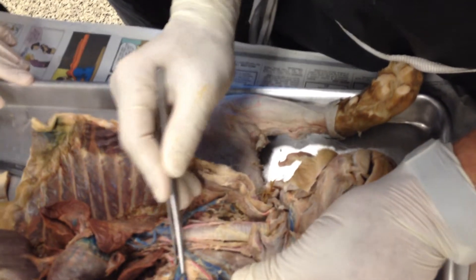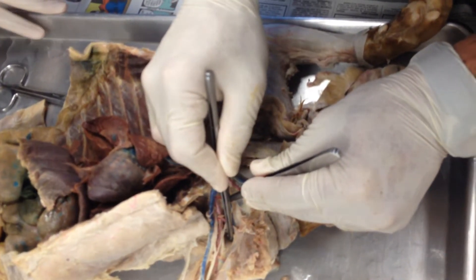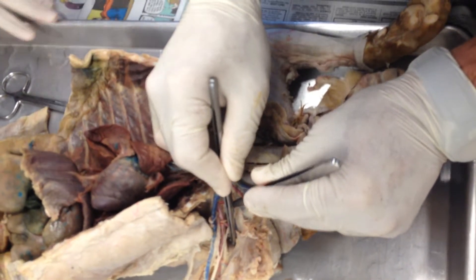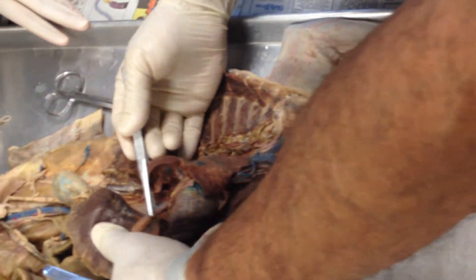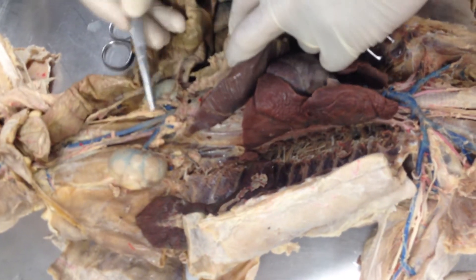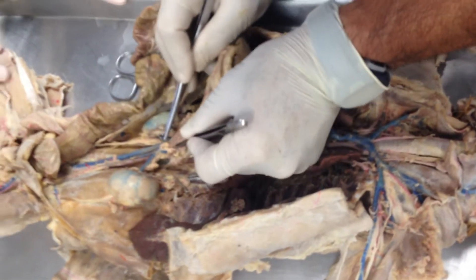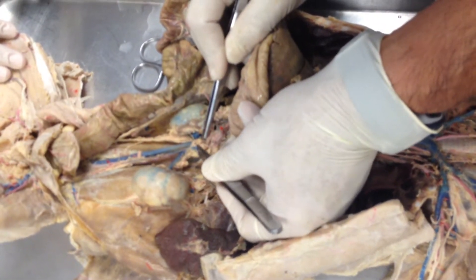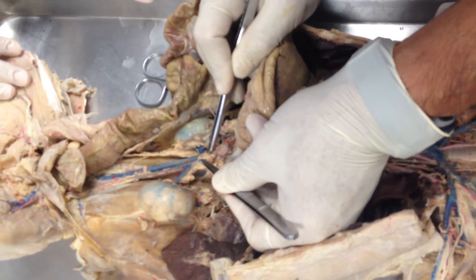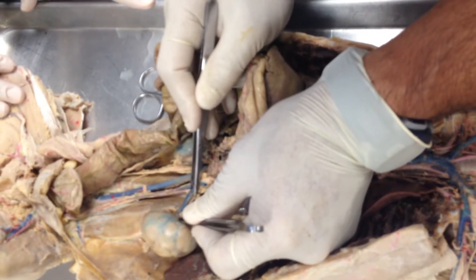There is the subclavian and there is the subscapular coming from behind the scapula. There is the inferior vena cava continuing right there. You have a nice adrenal gland right there and a nice adrenal lumbar vein right there.